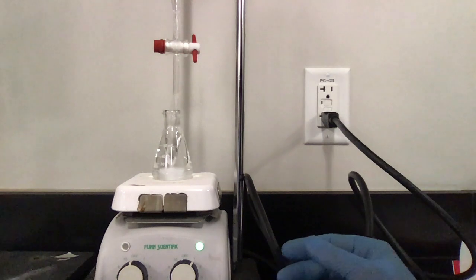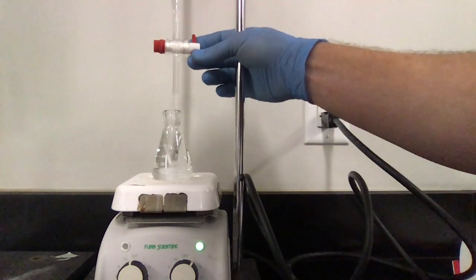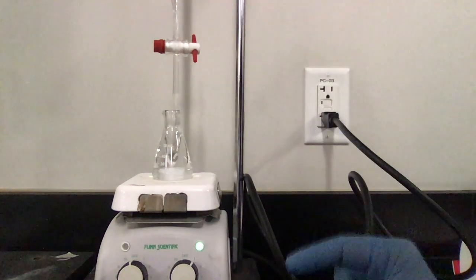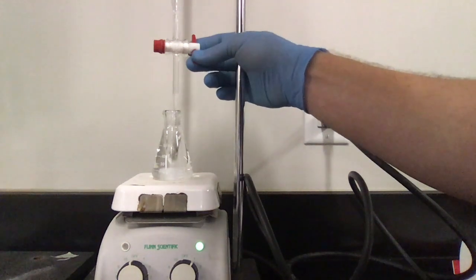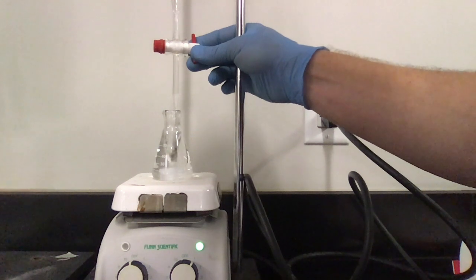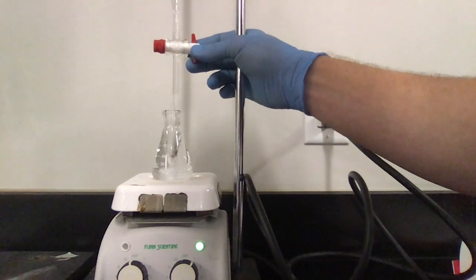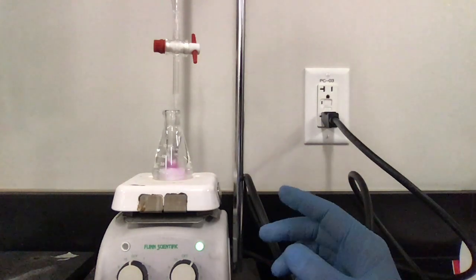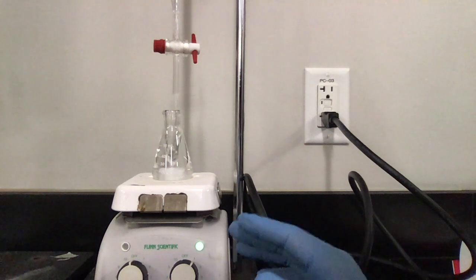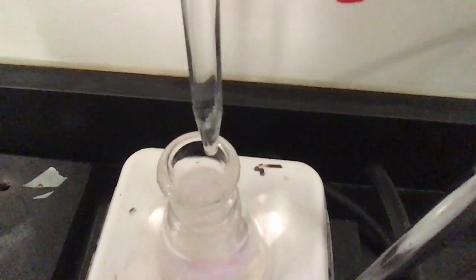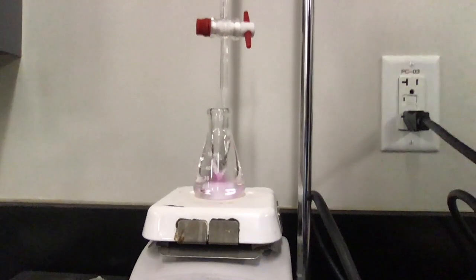I'm going to slow my titration down even more. And there's a couple of ways, we're still a little ways away, but it should be pretty dang close now. You see how it's getting longer and longer? That pink drop is getting longer and longer. It's going to drop in there. I'm going to take a moment to react and then it's going to fade away as it reacts with my acid. Drop pink, drop pink. I've always preferred to do it this way, where I'm adding a drop wise. This is a very, very slow drop. I don't know if you guys can quite see it. See, it's a very, very slow drop. And it's getting really, very pretty close now.